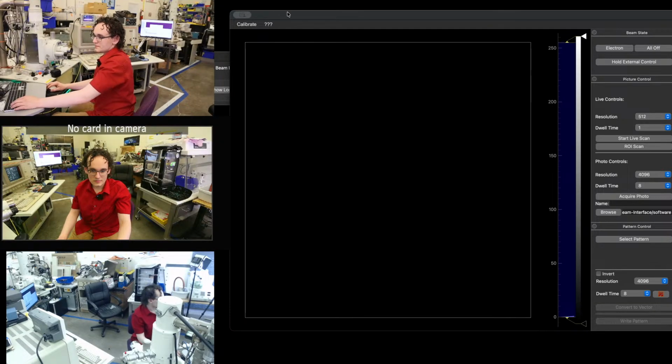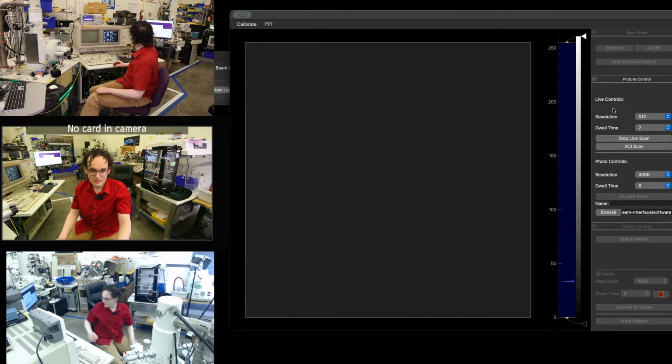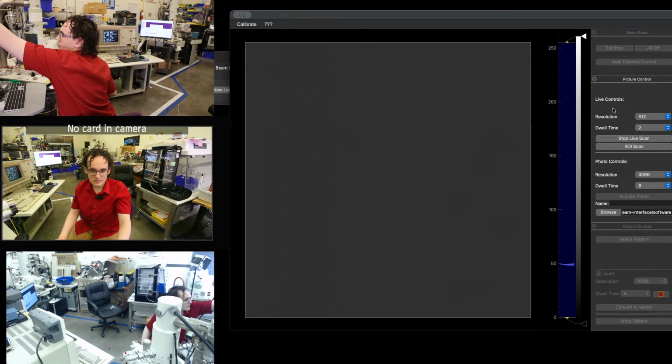Okay. So let's go ahead and we're going to start scanning now. So we'll start our live scan. We'll do 512, dwell time 2. So let's turn up our contrast, see if we get some detector snow. I think this one crashed. Camera crashed. Yeah, it is a little bit frozen, isn't it? How's it looking now?